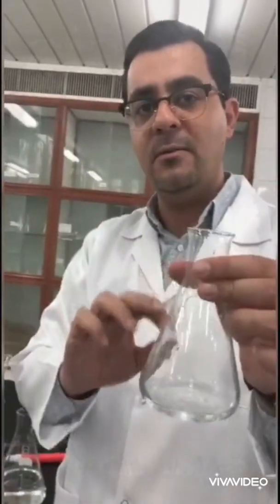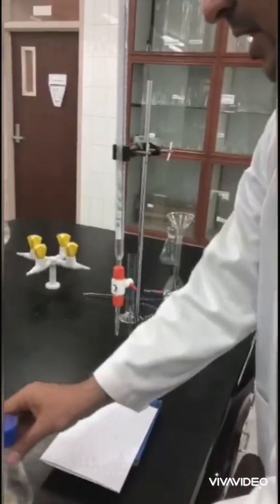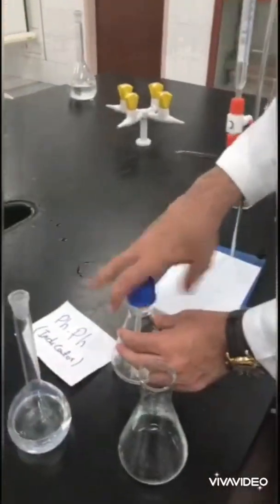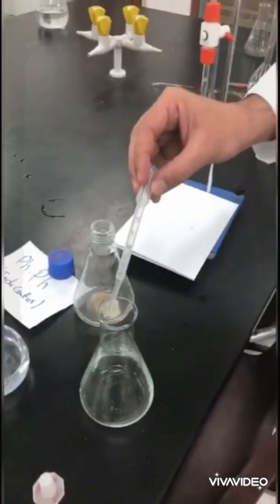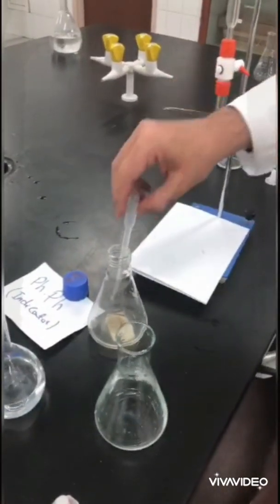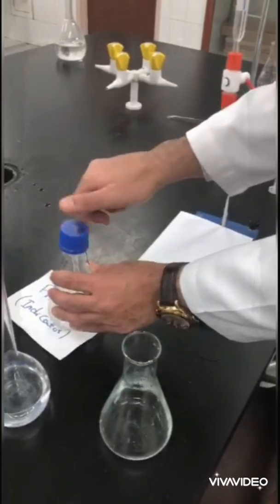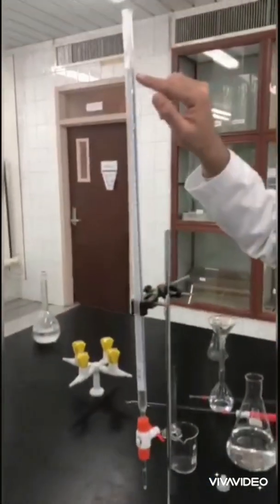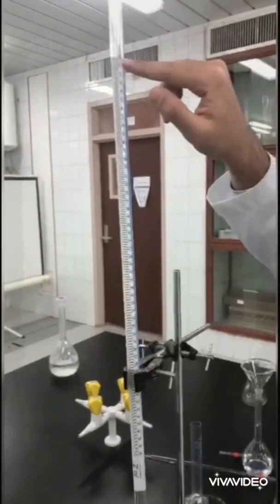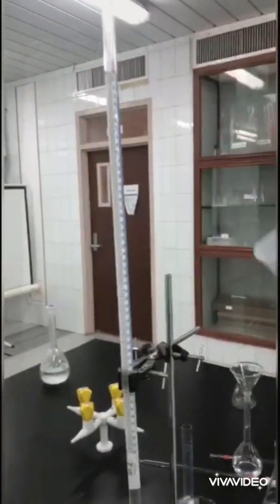Then I will add one drop again. One drop is enough. The burette is refilled with—sorry—NaOH again here. Then I repeat the previous procedure, adding sodium hydroxide stepwise until we reach the endpoint.